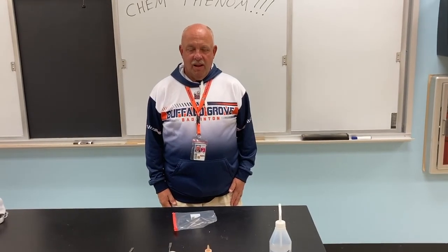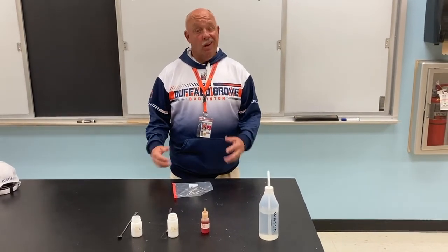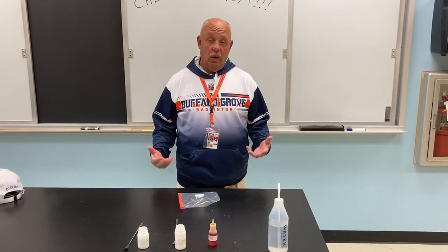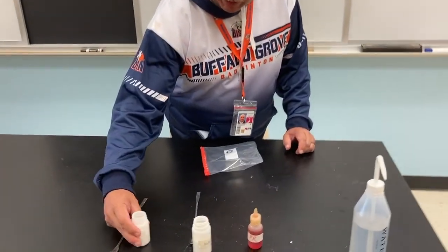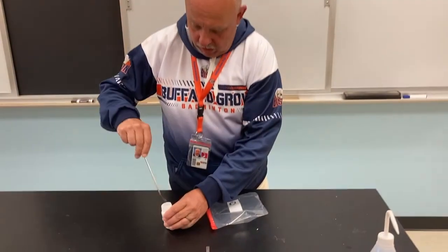And we're back. All right there, ladies and gents. So what we're going to do at this point, we're going to try to figure out exactly which of the chemicals are doing what and what's causing the different things. So the first thing we're going to try to do here is take the calcium chloride, and I'm going to get a little bit of that.